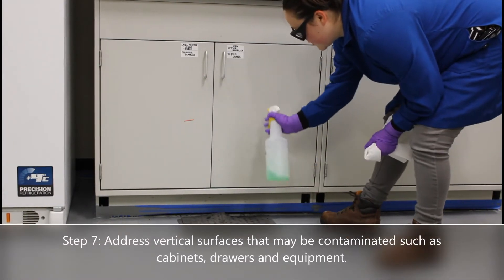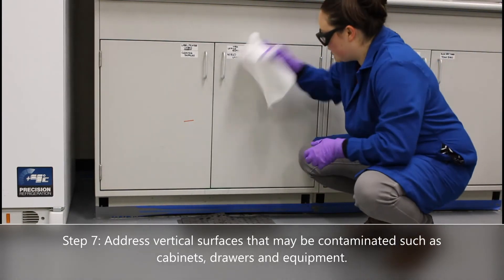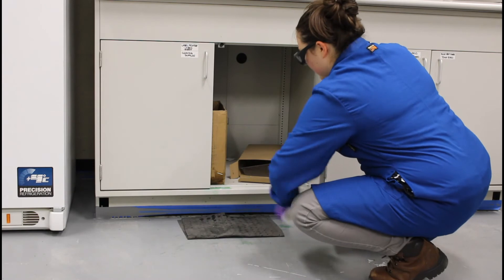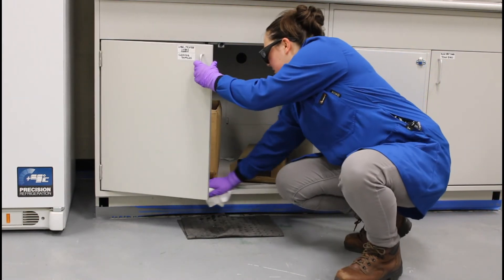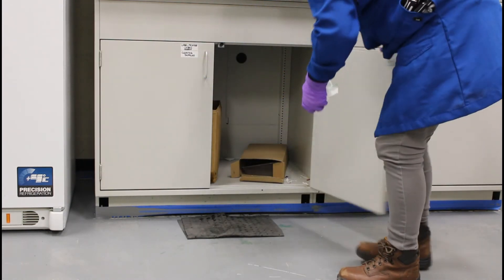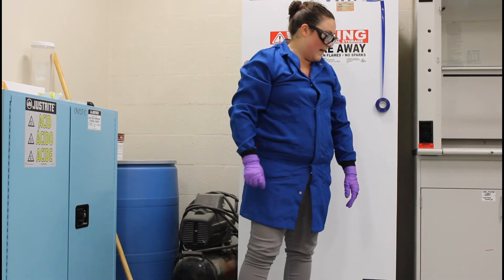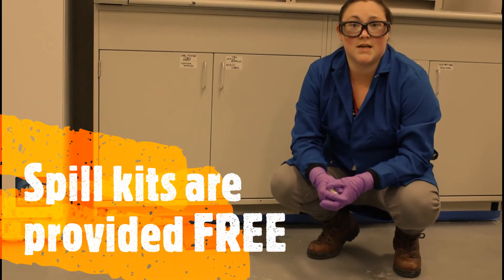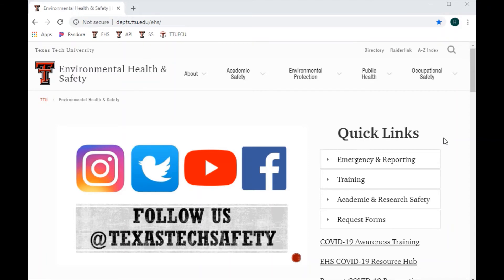Use an appropriate disinfectant or cleaner depending on your material, and wipe down your vertical surfaces as well. Make sure you open up cabinets to clean materials inside. Then mop the area afterwards with a typical cleaner you use for your lab space. After you've used your spill kit provided by EH&S, you can contact us and we can get you another one.